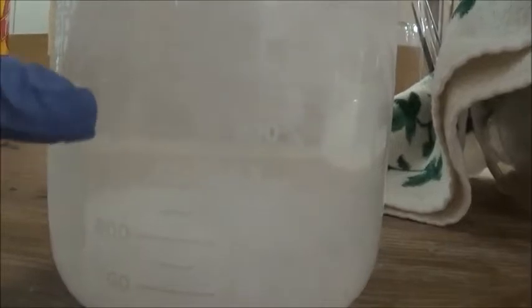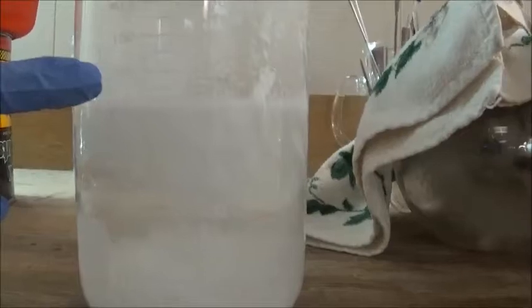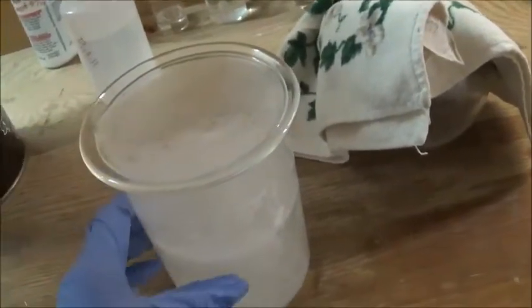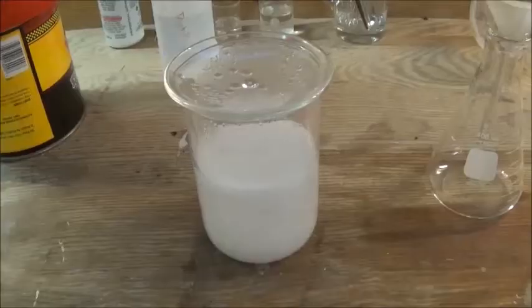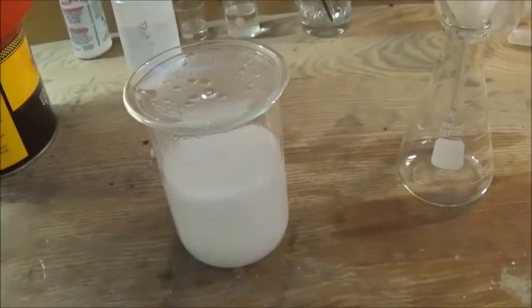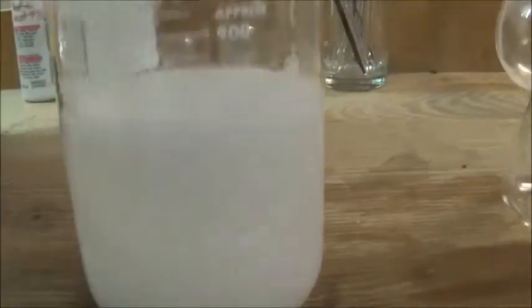I transferred everything from the flask to this 1 liter beaker, and you can see from the solid in here — as soon as the solution touched the cold beaker, it precipitated a bunch of salicylic acid, because it's a very saturated solution. That's unfortunate because we won't have as nice crystals, but oh well. You can already smell the acetic acid. I'll just leave this until the morning because it's getting late. It's the morning now — it's been about 12 hours. This has cooled down to room temperature, which in the lab is about 12°C. Pretty chilly, but there are a lot of crystals. They're pretty small, sadly.